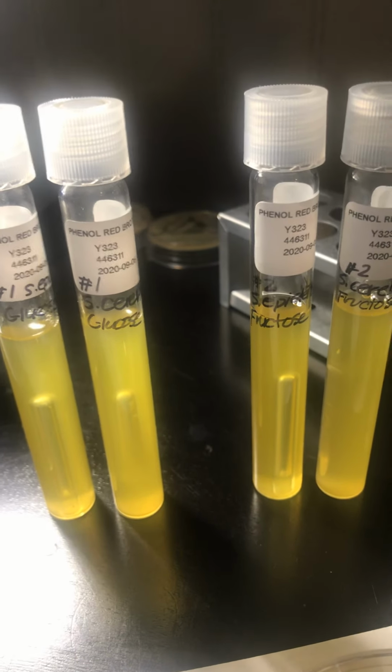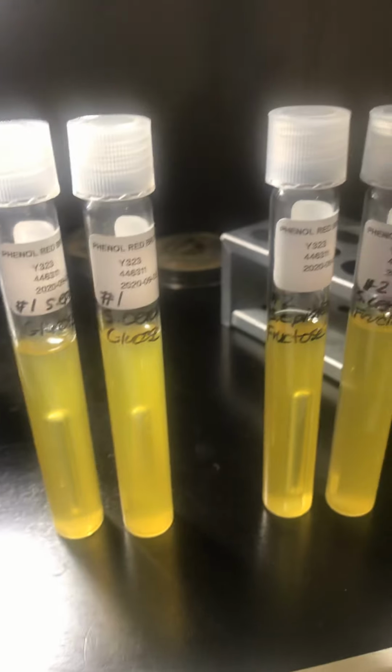And part 2 of it is called the carbohydrate fermentation results, which I will be sharing with you in the second video.